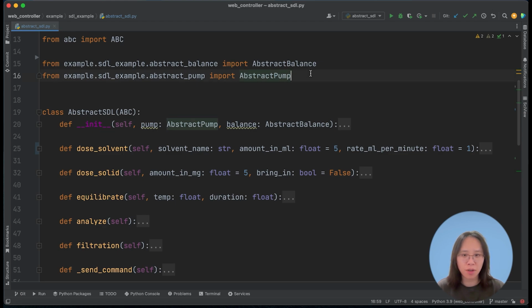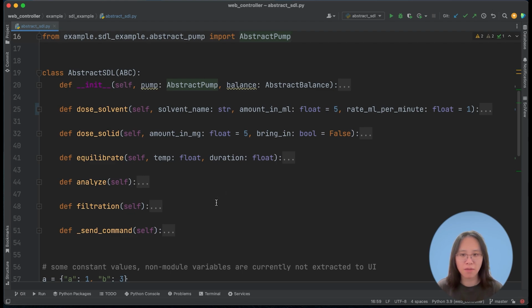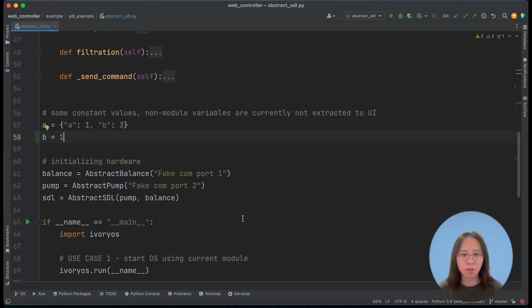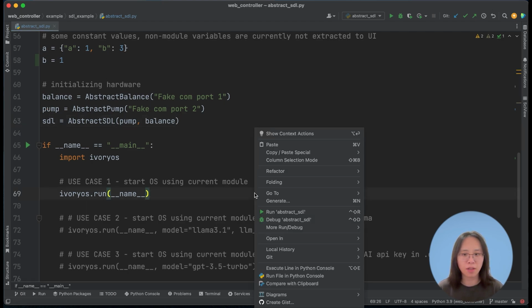In this one, I've imported two classes, which are the abstract pump and balance, and I'm pretending these to be the high-level SDL functions that have five user functions and one private function starting with an underscore. The private function is not going to be extracted to the web UI, so by default it is not available to the user. Below that, there are some constant values. And now here we have the instances of your hardware modules, the pump, balance, and the high-level SDL functions. In the same script, I import ivoryos and then start running the UI using the current script.